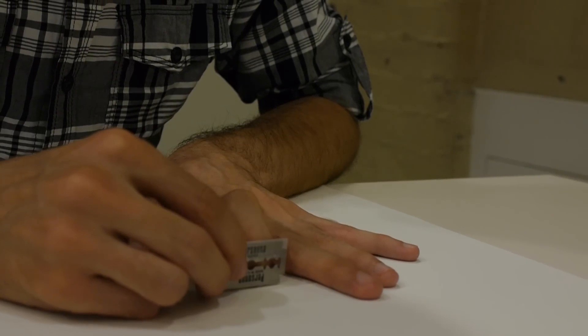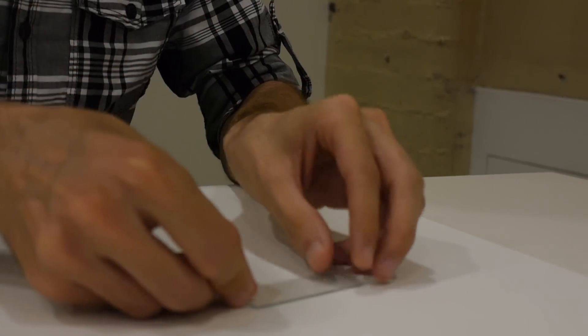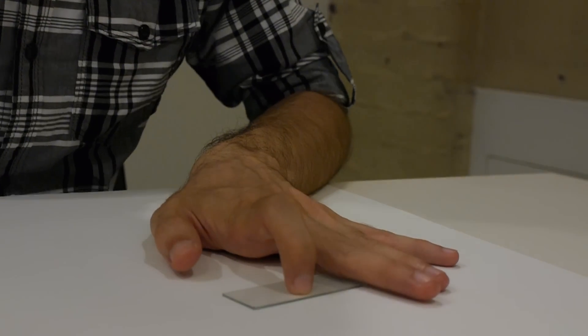If you are having difficulties placing your finger at a right angle, you can also use an alternative approach that involves the use of a ruler or another glass slide.